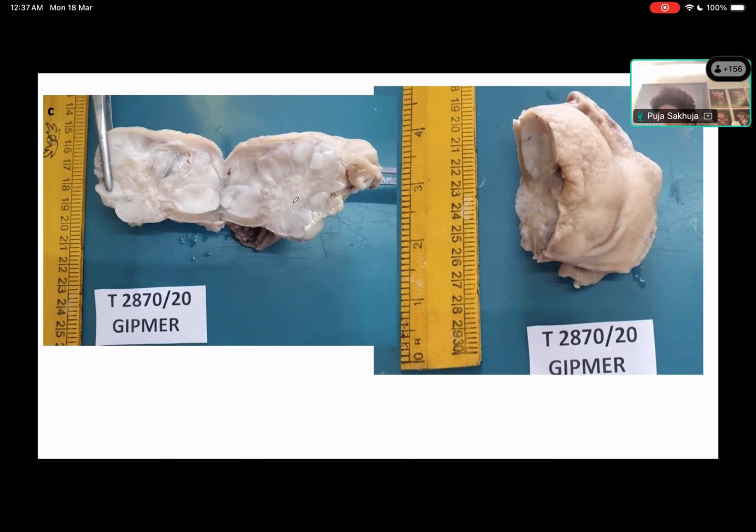So we were with Pragya. Pragya, can you describe, or let's go on to someone else who has not spoken till now? Everybody has contributed a little bit, I think. Chaitanya, you contributed, but have you described anything yet? Okay, Pragya, you continue. Describe the gross feature of this lesion. It's a multilobulated mass, and it is well circumscribed.